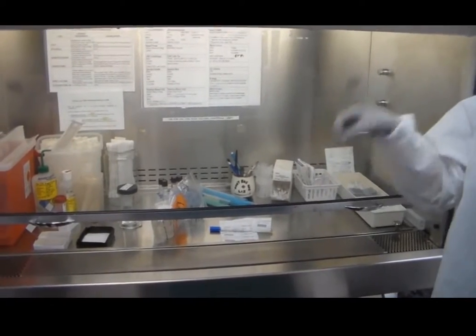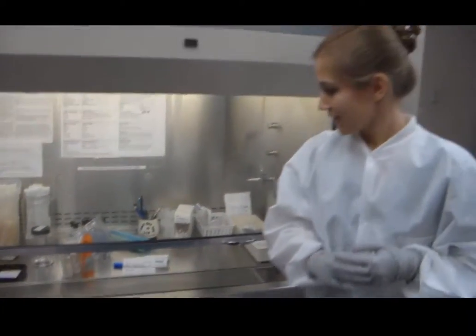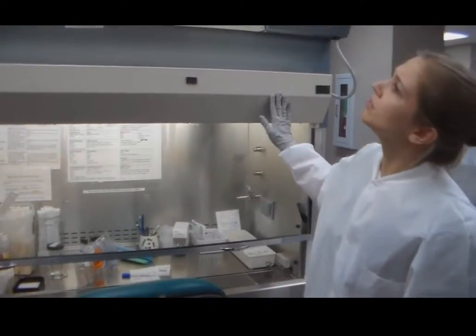You guys have codes, right? And tags and all that. This is a level 3. Yeah.